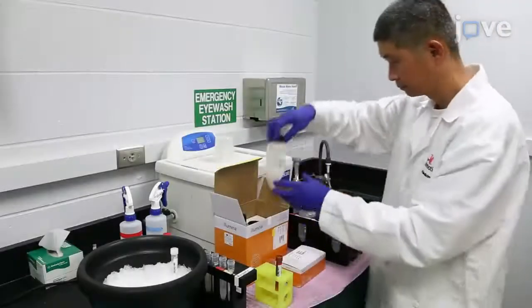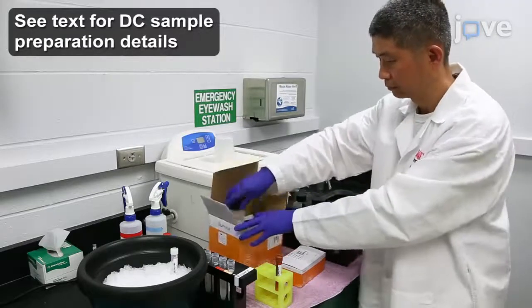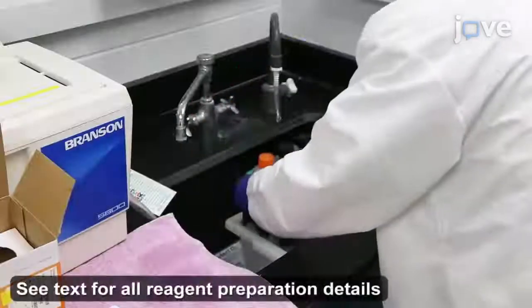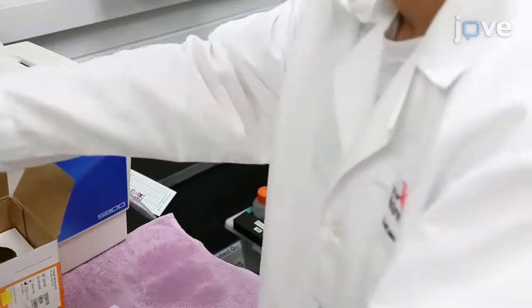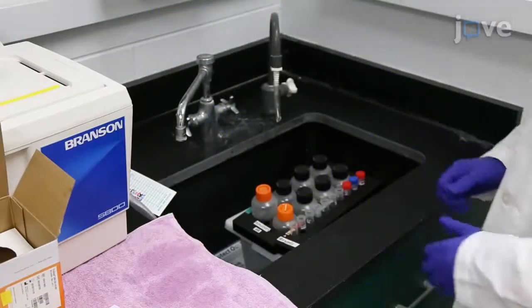To sequence the human monocyte-derived dendritic cell library, first load the sequencing and indexing reagents onto the sequencing by synthesis and indexing reagent racks, respectively, and place the racks in a laboratory-grade water bath for 1 hour until all of the ice has melted and the reagents are mixed thoroughly.